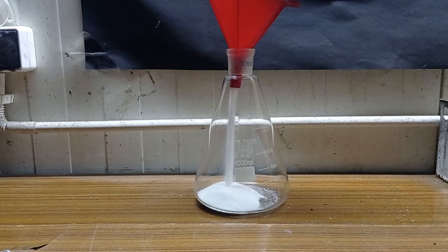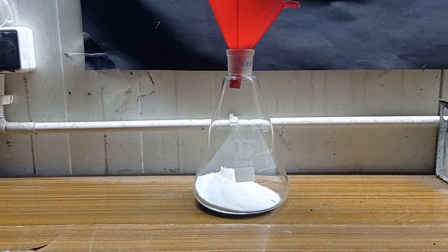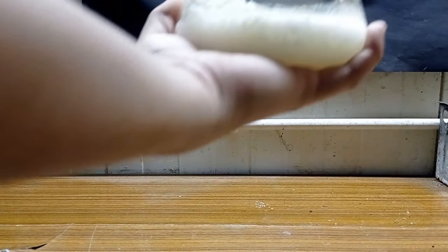I transferred everything to a 1-liter flask. My ammonium nitrate is a bit wet so I added a bit less water. I poured 150 milliliters.